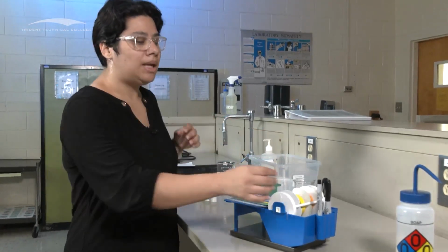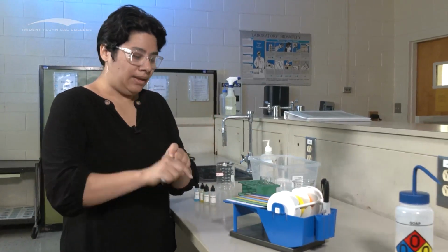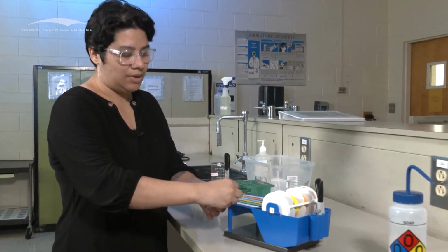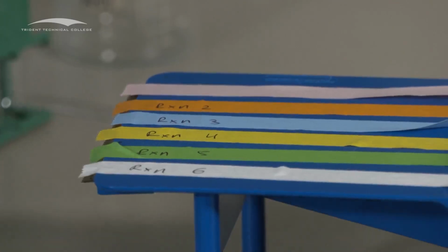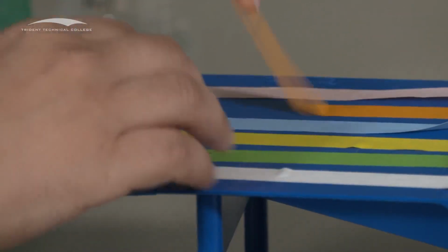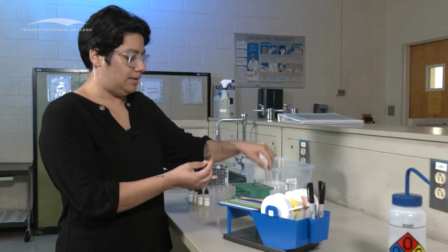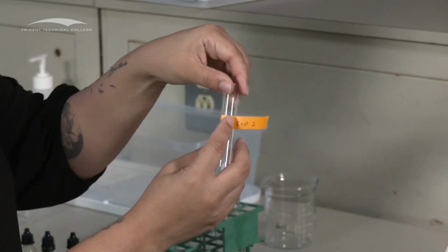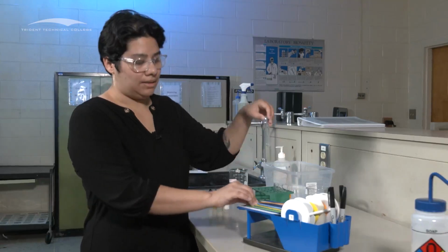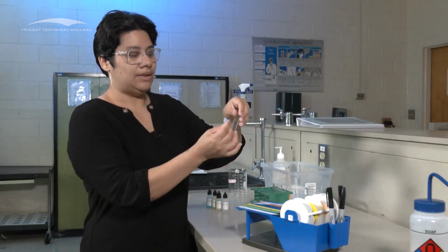You don't have to. But to use this tape dispenser, what you're going to do is you're going to get a Sharpie, and then you will write on the actual tape in the dispenser. Some people like to rip it off before, so I would do reaction 6 for this one. And then to rip it off, just lift it. And it's a lot easier to do without your gloves. So then you put this here, like so. And it will go around. And then you will do the rest the same with all of them, like so.